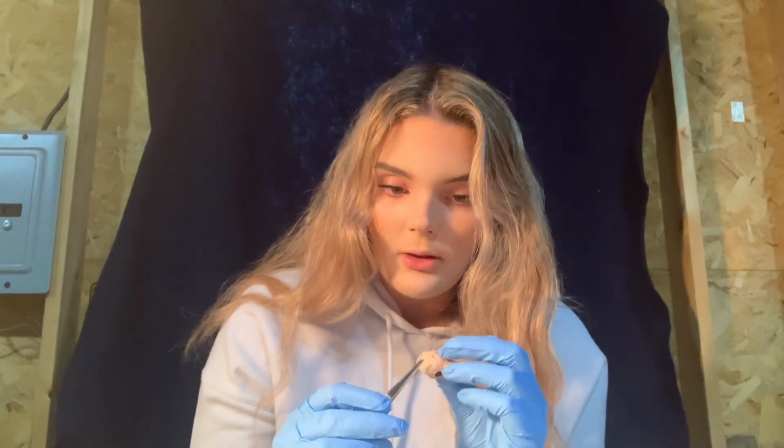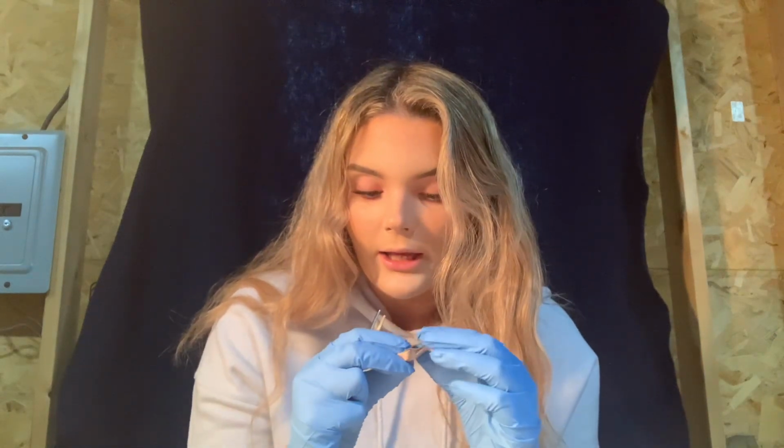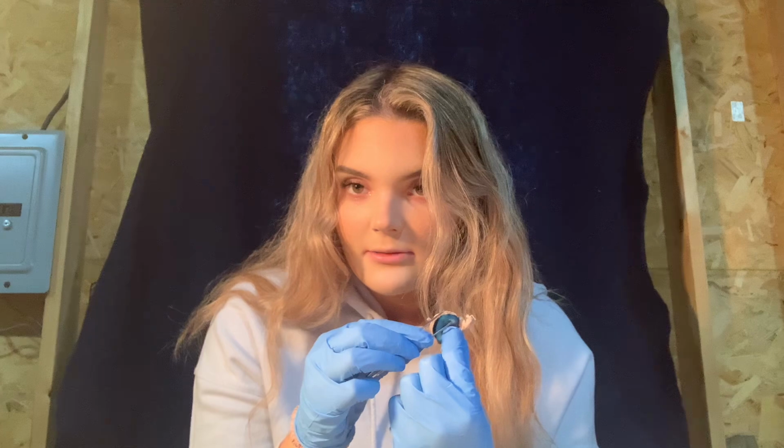And then the sclera is the outer covering of the eyeball. It's tough, sheeted connective tissue, and it protects the inner structures of the eye and helps maintain rigidity. And then we have the tapetum lucidum, which is this. This is the iridescent part of the eye, this iridescent part right here, and it helps in night vision by reflecting available light back into the retina.